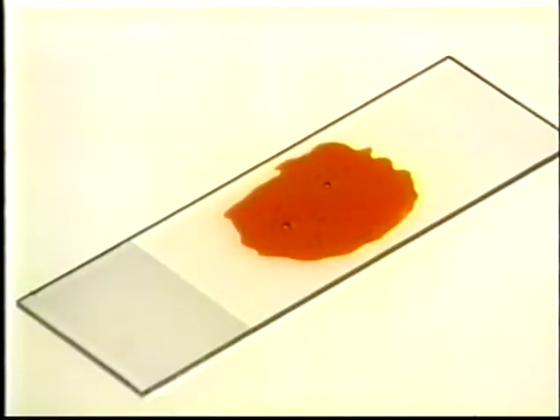Sometimes the material is mixed with significant amounts of blood or other liquids. This makes it harder to make good smears. One problem is that the tissue component is diluted and may get lost in the process. The other problem is that blood, when present, will sooner or later clot and trap the diagnostic component.